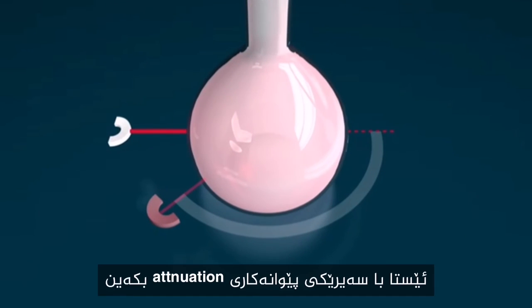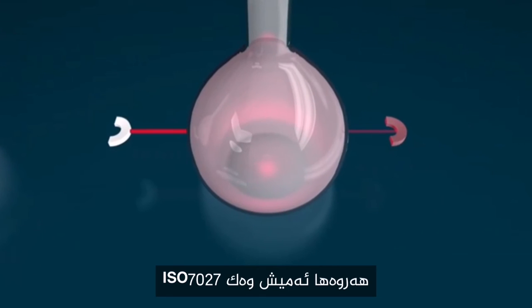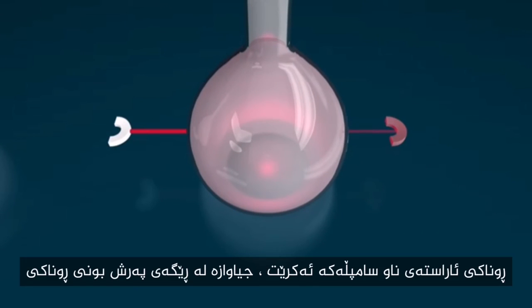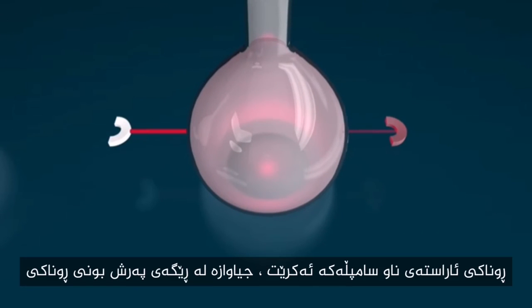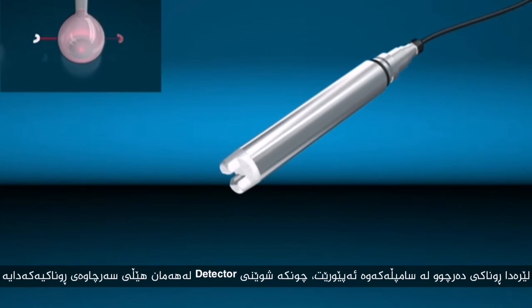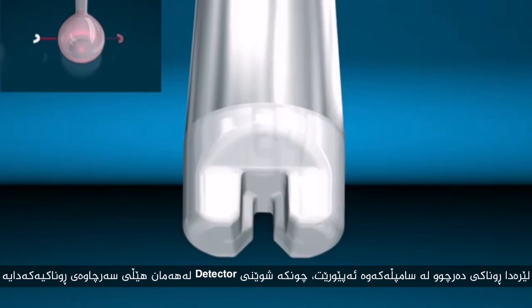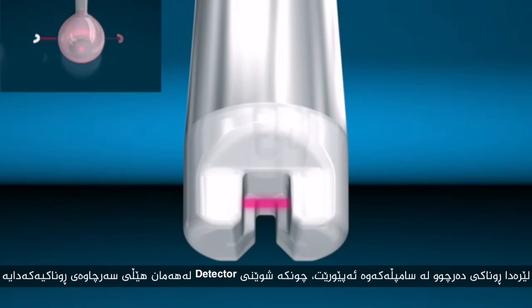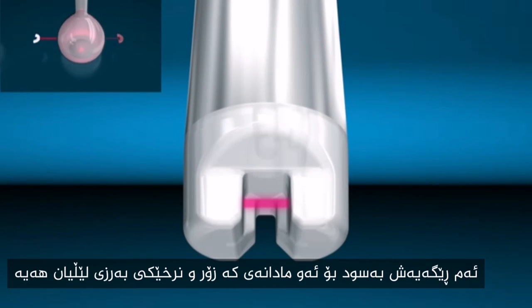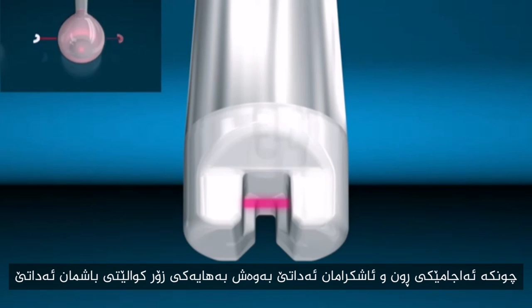Now let's take a look at attenuation measurement, also described in ISO 7027. Here again, a light beam is radiated through the medium. However, in contrast to scattered light methods, the transmitted light is measured because the detector is positioned in one line with the light source. This method is suitable for average to high turbidity values because it delivers definite results and offers high reproducibility.